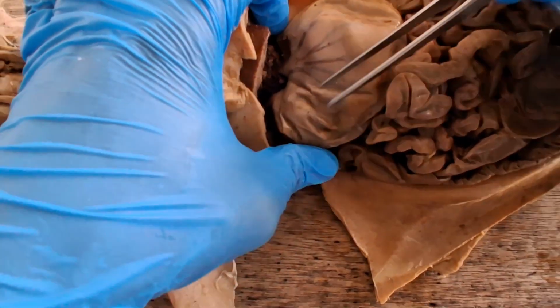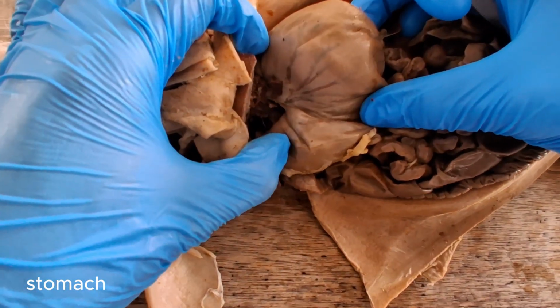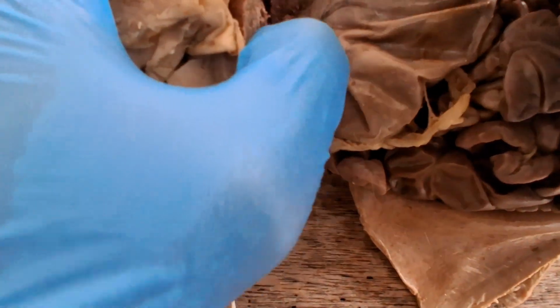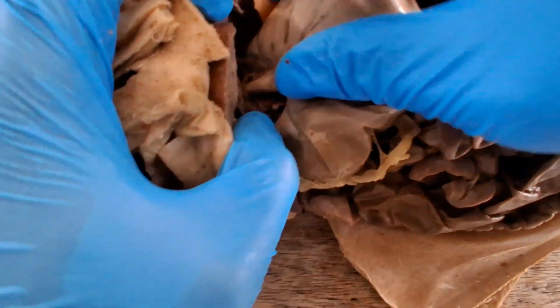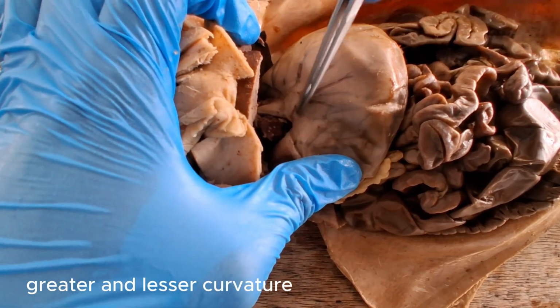So this is the stomach, an expanded portion of the alimentary canal where food is temporarily stored and proteins are digested. I don't know if you can see, there's the esophagus here, and then it enters the stomach. The stomach has a greater curvature and the concave lesser curvature.